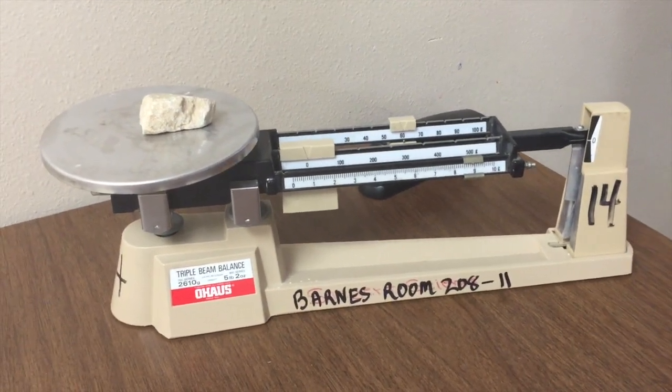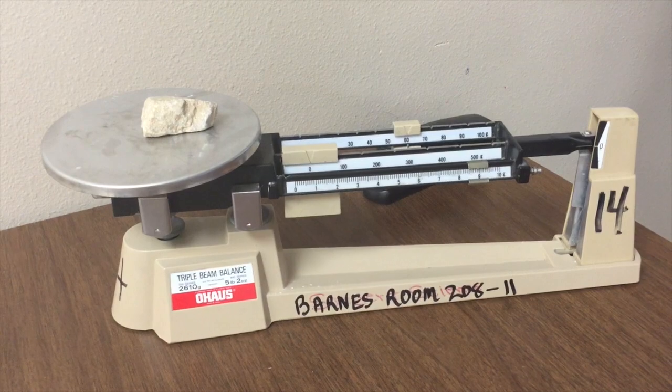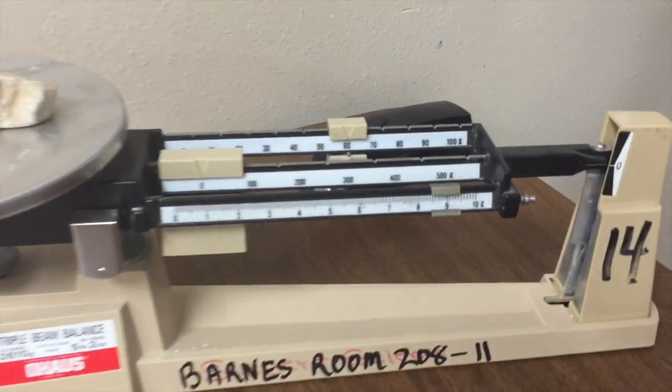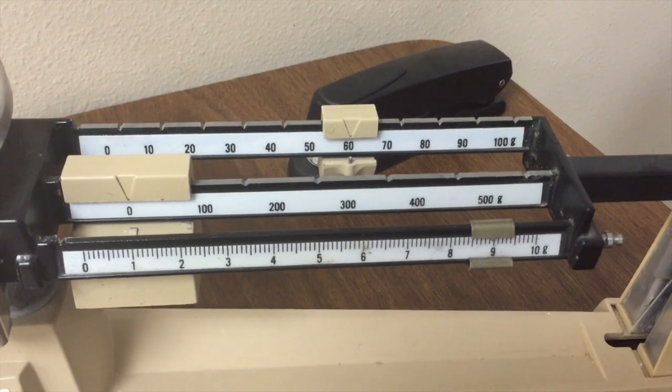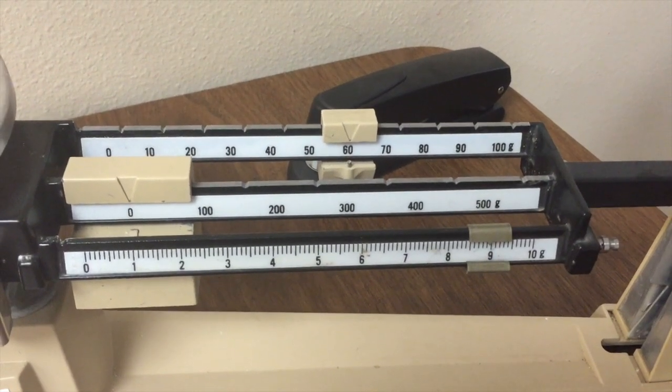Now we're going to measure a rock. Please be careful when you're reading this and notice that there are zero in the hundreds. Again, if you need to pause the video to read this, please do so.